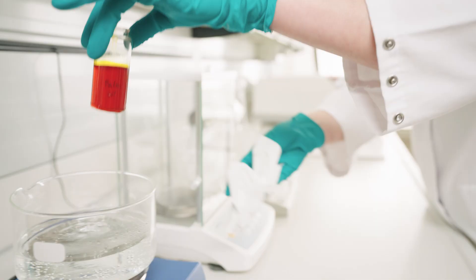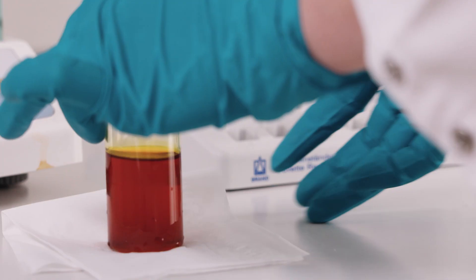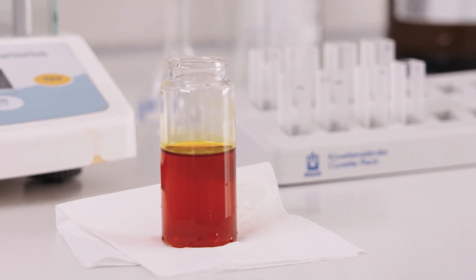If, after heating up, the oil is still not transparent, we will need to separate the suspension from the solution. For the following step, we will dissolve a small portion of crude palm oil in ISO octane.